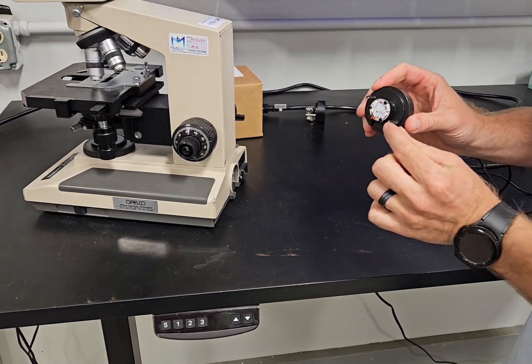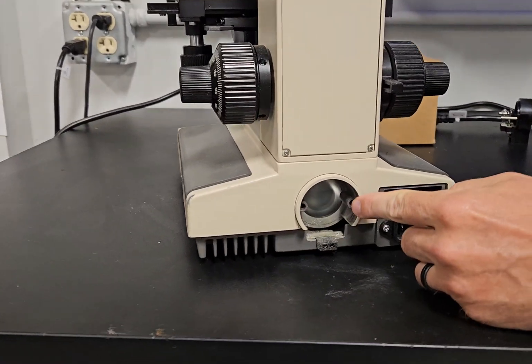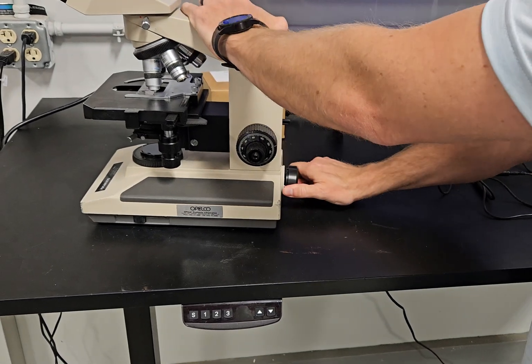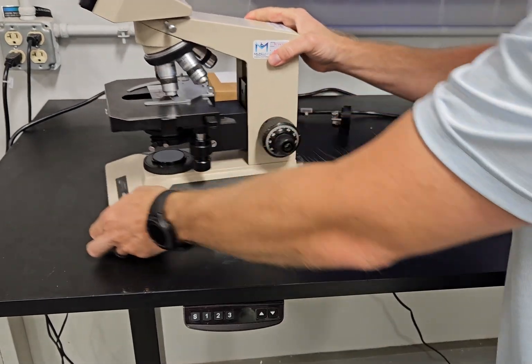It is a very tight fit, but these pins will align with these two holes. It's a plug and play situation. You do have to wiggle it in because it's a very tight fit, then it goes in like that.